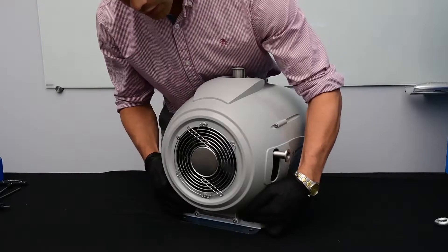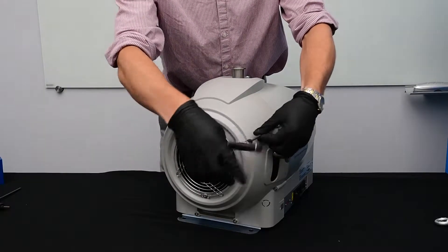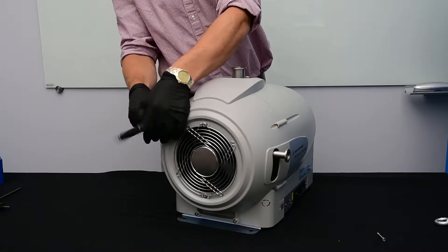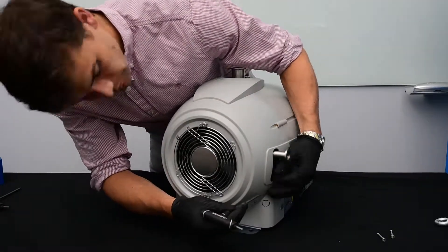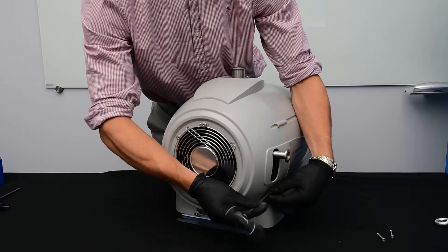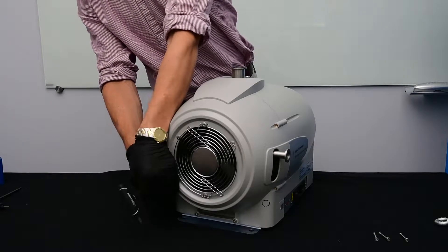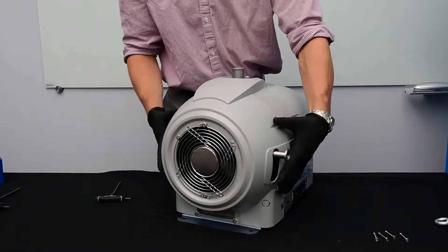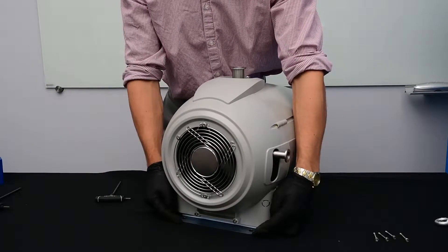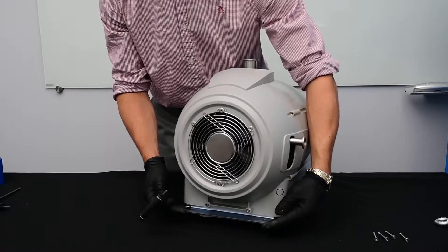There are six four millimeter Allen head screws that we're going to have to remove. I started and removed the top four bolts first. When you remove the last two, don't be surprised when this metal foot drops off. I'm going to put a book under the pump in order to more easily access those screws. I place the book under the feet here so this metal plate can drop off.